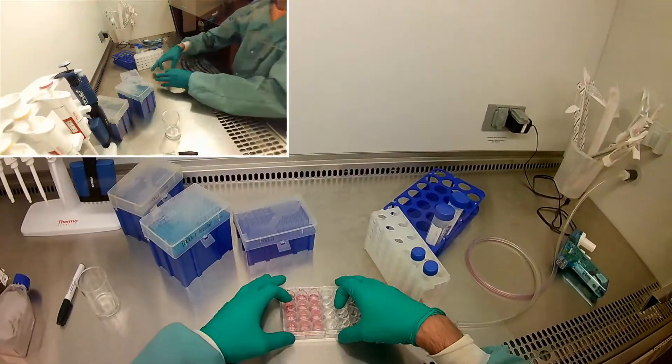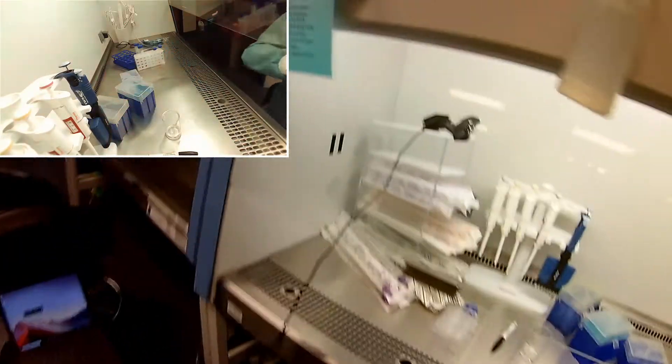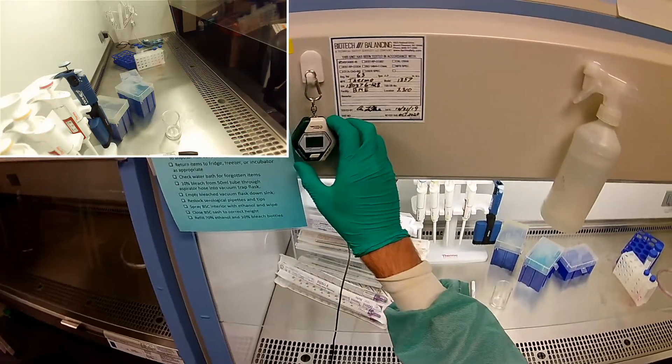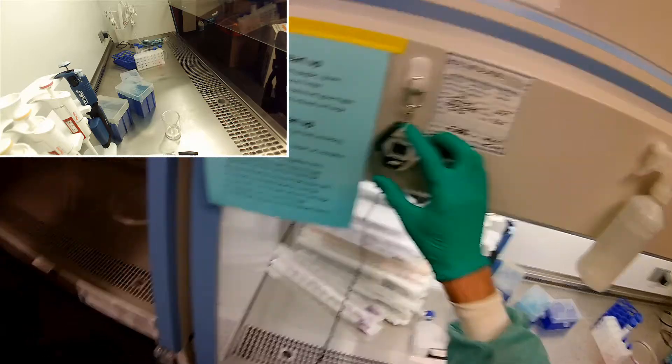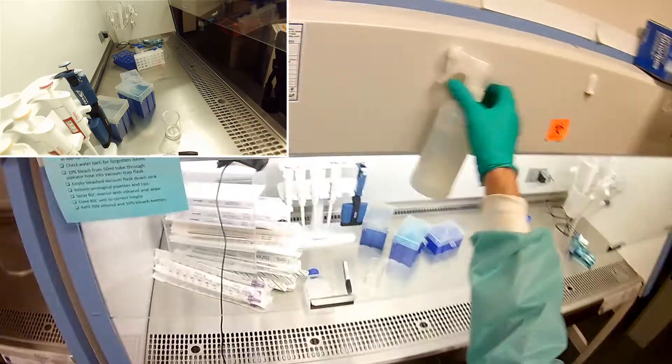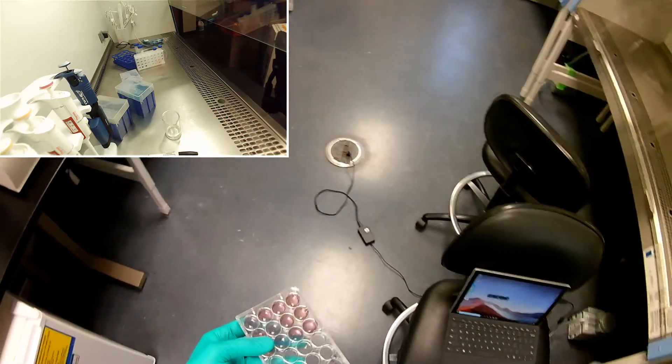But as I said, an hour and a half is not going to be that big a deal. So we're going to go ahead and set our timer. And we'll stick these things in the incubator for an hour and a half.